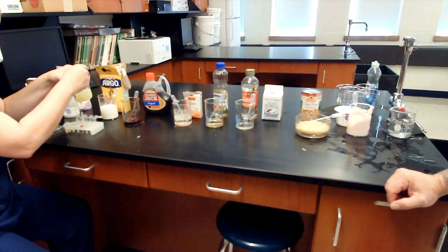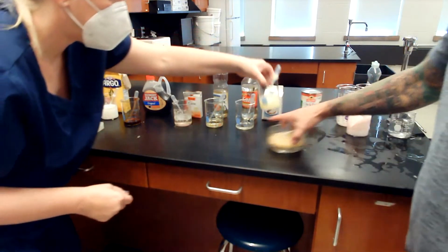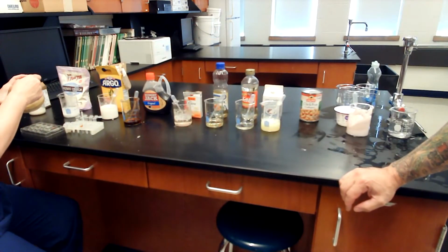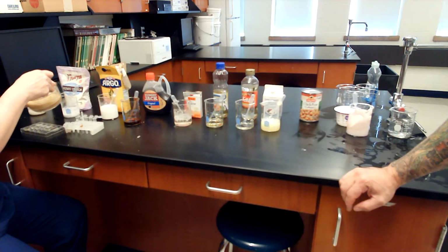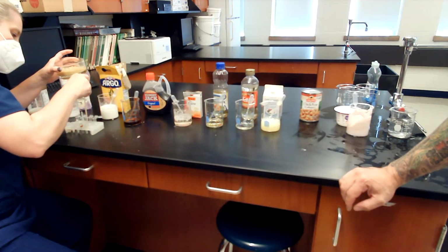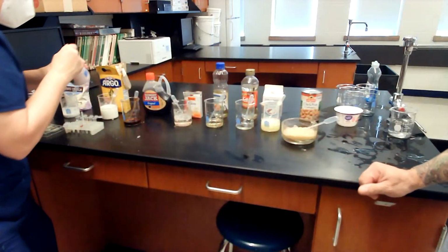Egg whites. We got crushed garbanzo beans. Yogurt. It is a flavored yogurt.